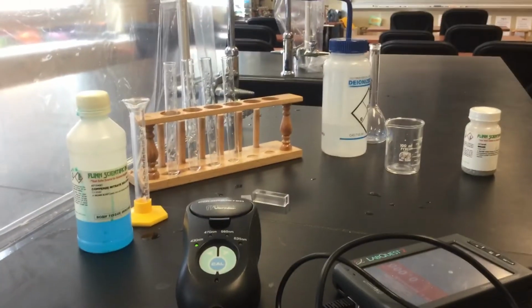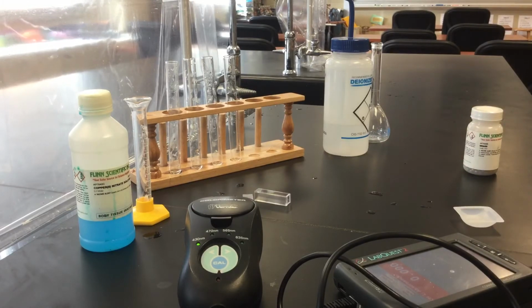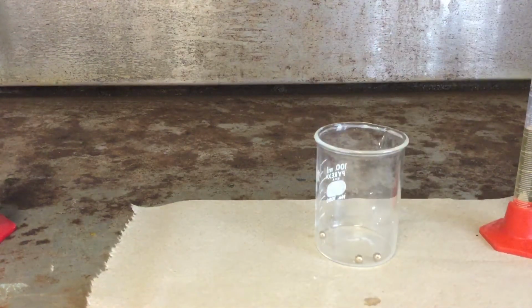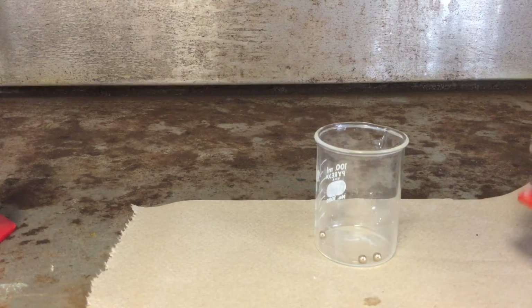Okay, then we'll take them back over here, and we're going to put them into a little beaker. And then we're going to go over to the fume hood to add the nitric acid. Now we actually did something similar to this in honors chemistry. If you remember the copper lab that we did, where we had copper wire instead of brass BBs, and we added nitric acid. So here's about 5 milliliters of nitric acid.